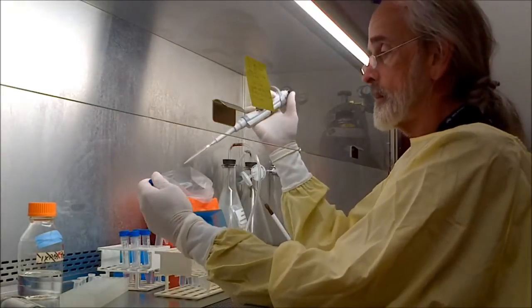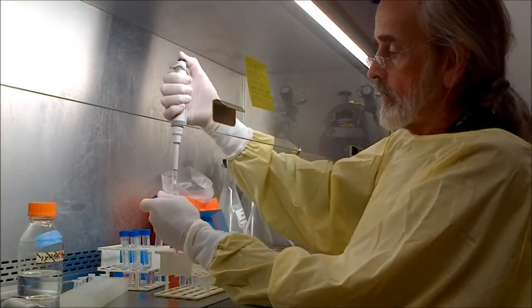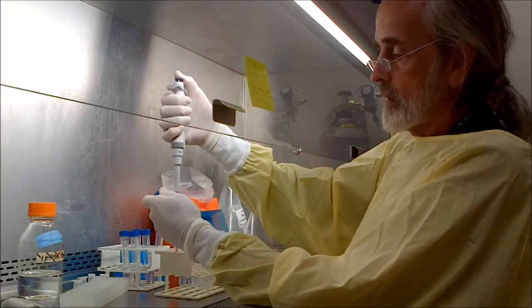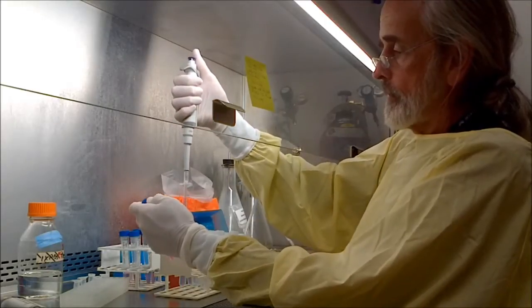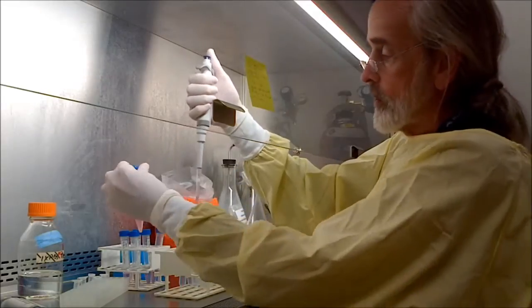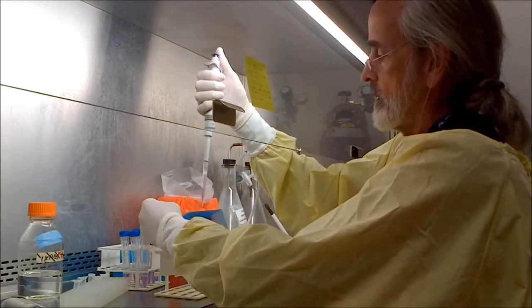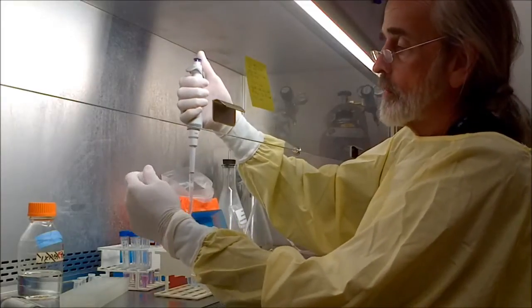Put my tips on. Take the virus. Draw it up. You have to be very dexterous. Make sure I've got the right one. 0 hour, first dilution.